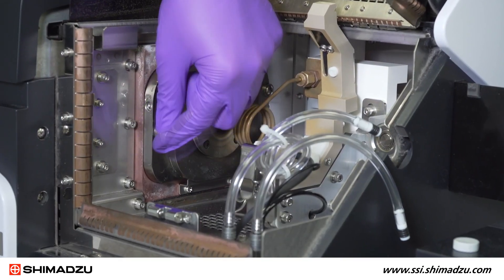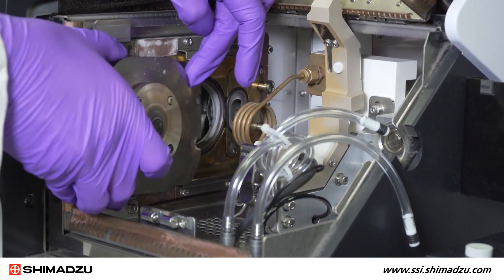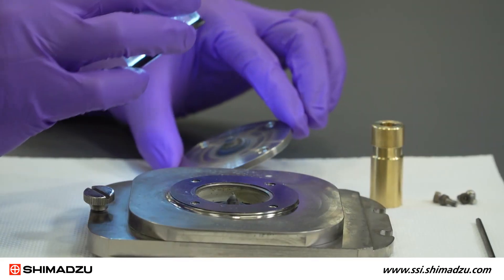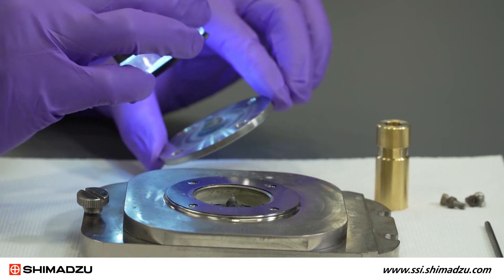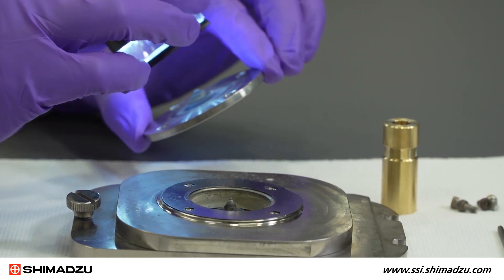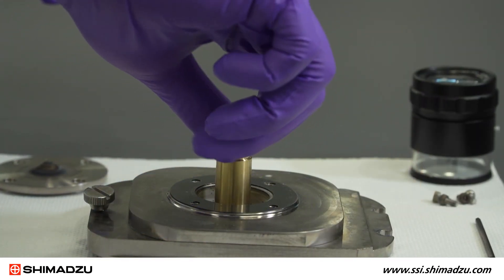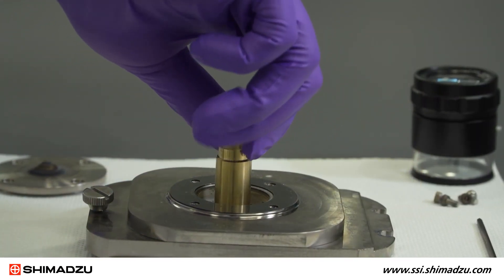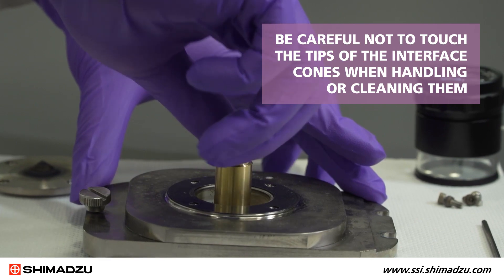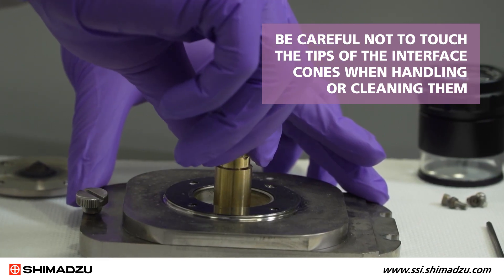The cones should also be inspected each time you use the instrument, prior to igniting the plasma. If the orifices of the cones show signs of clogging, you should consider cleaning or replacing them. Use the provided jig to remove and install the skimmer cone. Be careful not to touch the tips of the interface cones when handling or cleaning them.